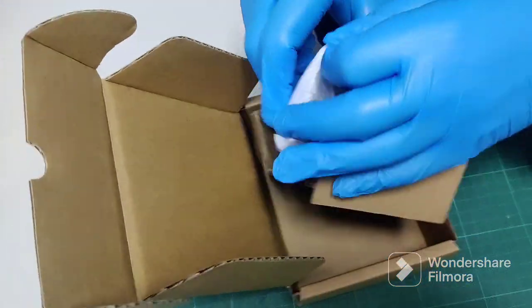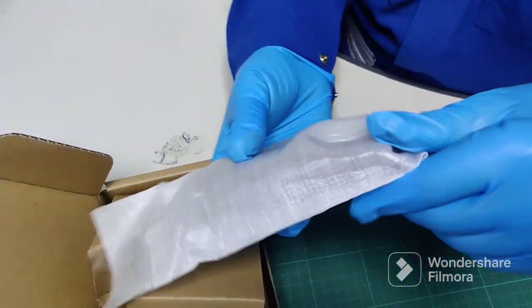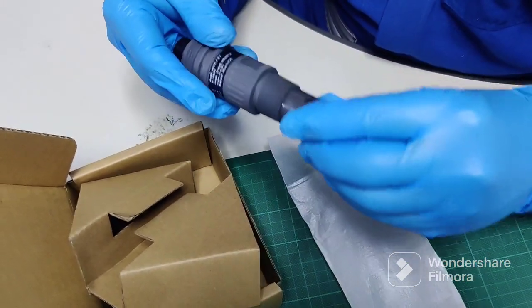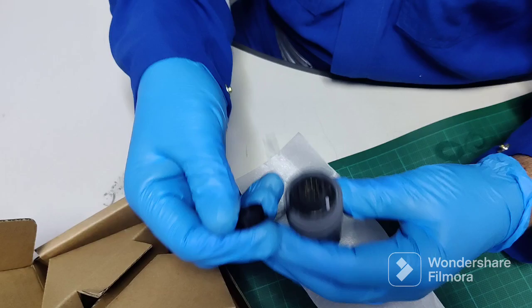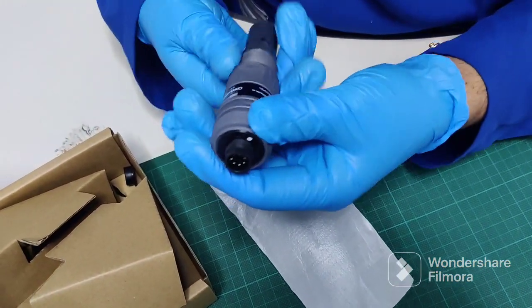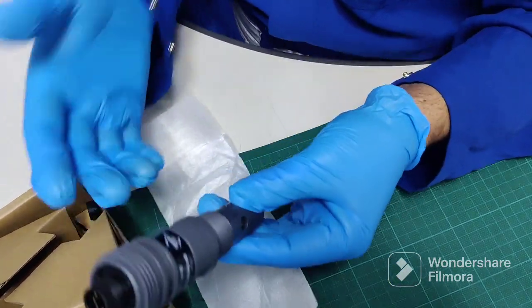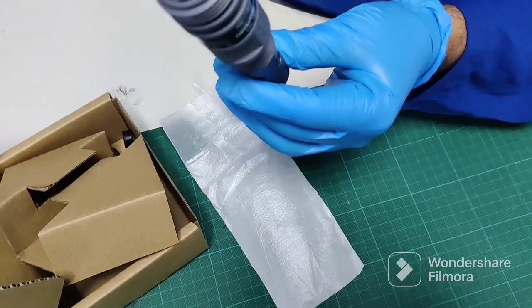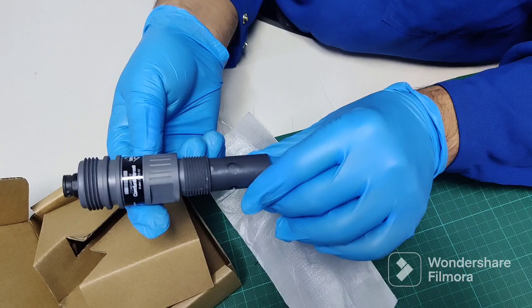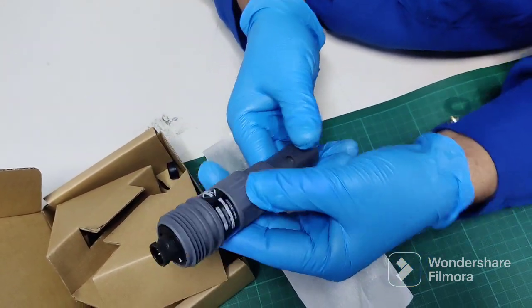First open like this. We need to remove this one from here and just connect outside — fix inside the other sensor outside where it's connected. You can see here.